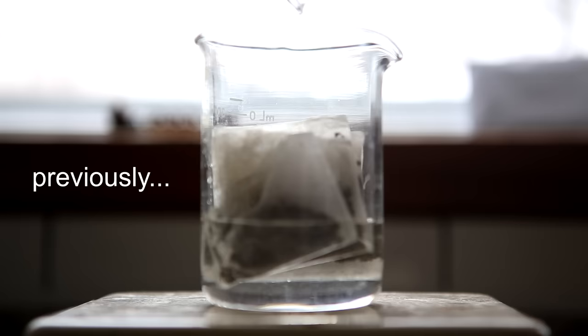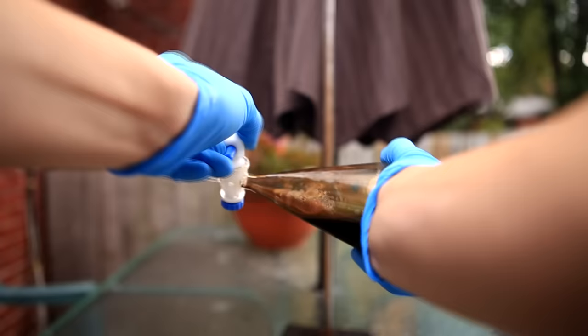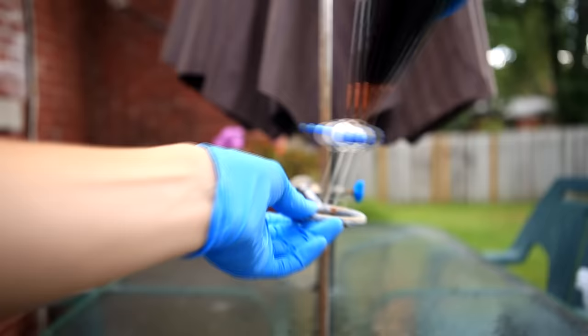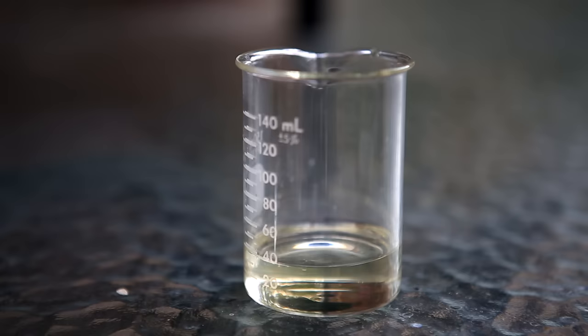Previously I made a video on how to extract caffeine from tea, but there were several requests on how to extract it from coffee. I decided to give it a try, but let me warn you that it's pretty much the exact same procedure as the extraction from tea.